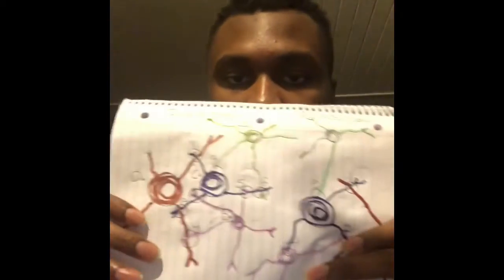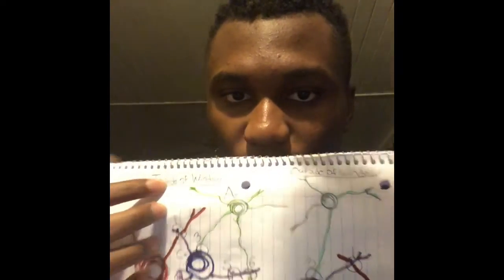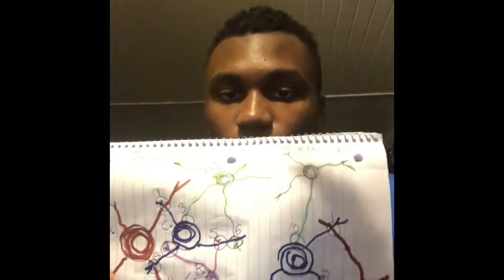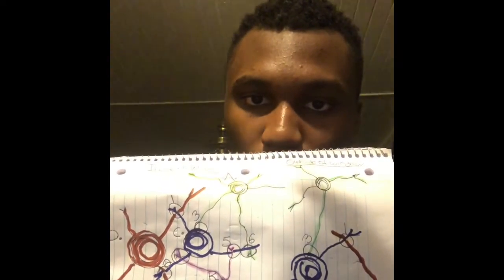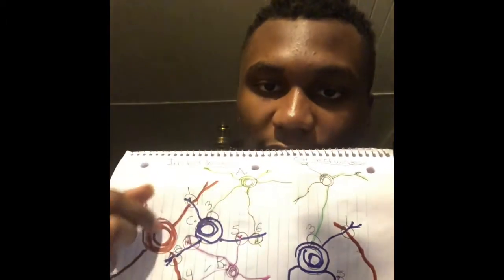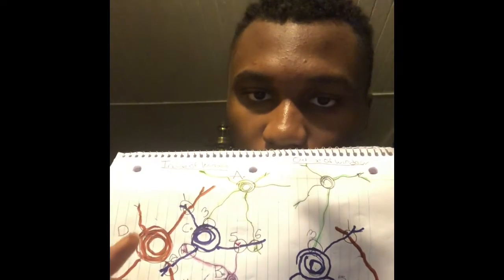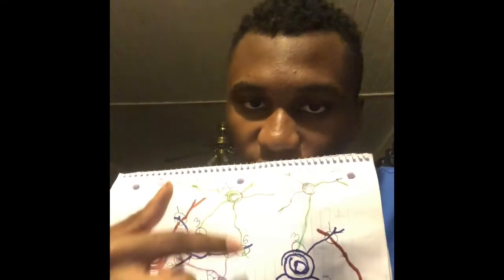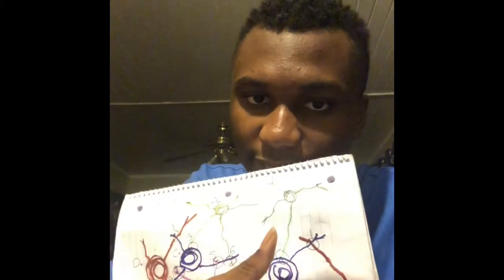Radial. This one is labeled inside of window, outside of window. Now, they're not exactly identical, but you see, I tried to mirror them. I also labeled them by letters. Like this is D, this is A, this is C, this is B. Same thing, A, C, B, D.